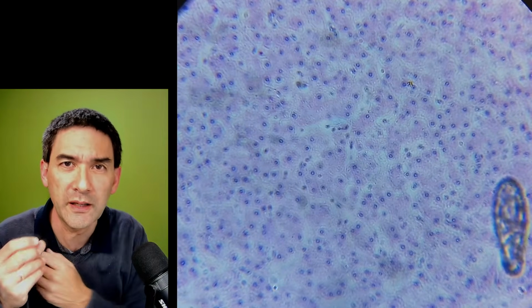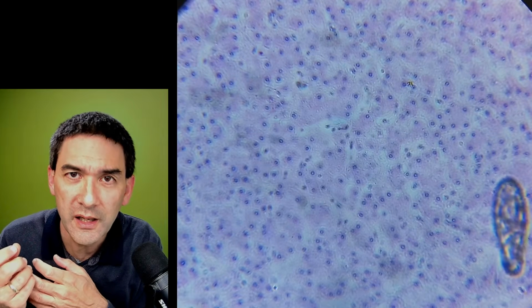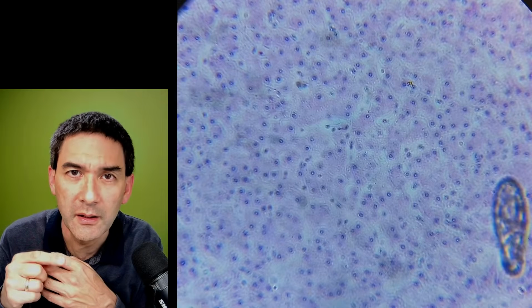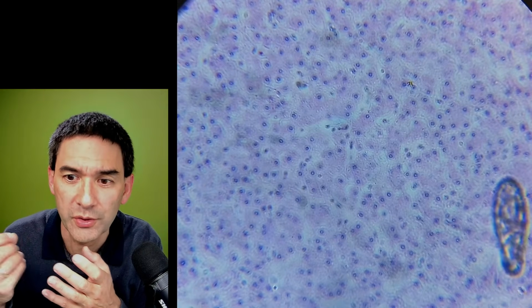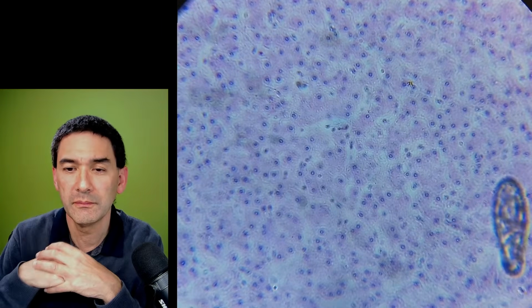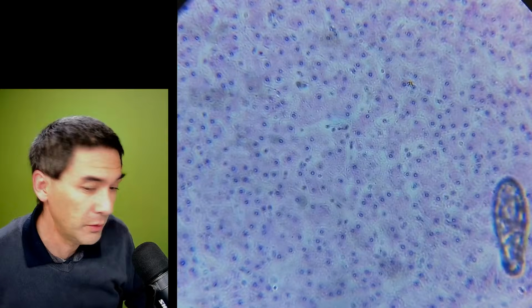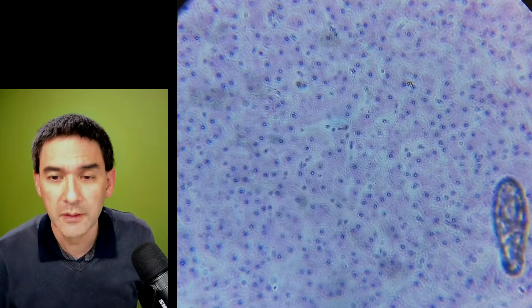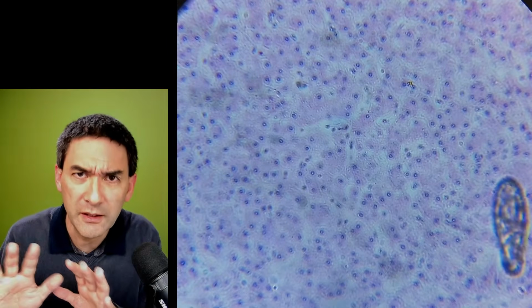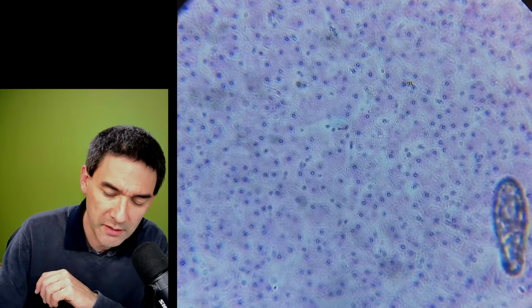I think it was more like a retailer for telescopes and microscopes, and they were offering this Digiklemme simply as an add-on for the customers. I have not checked their webpage for some time now, but it's called Digiklemme. To my knowledge, they had different versions of that, a smaller and a larger one, so you might have to check this as well.